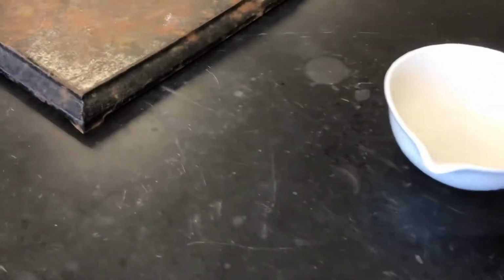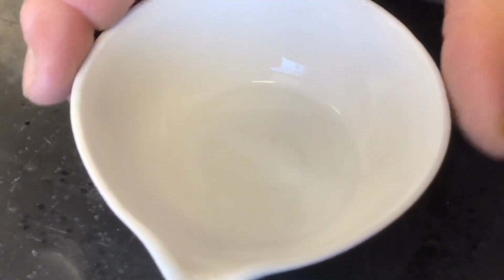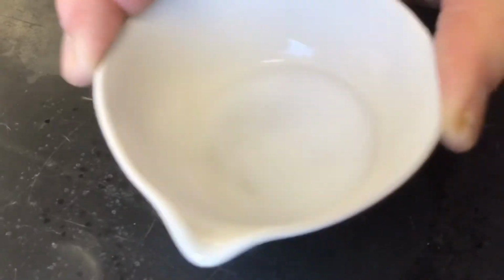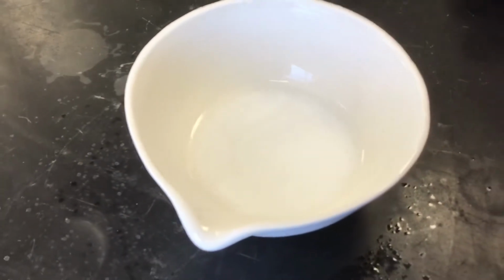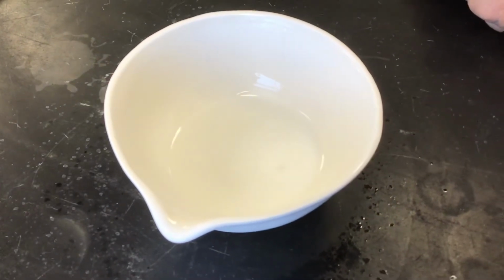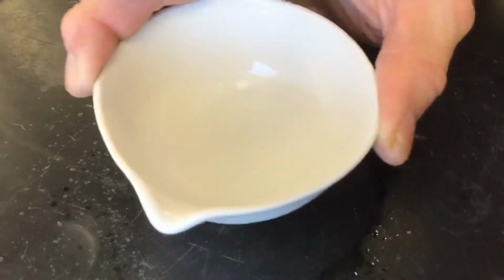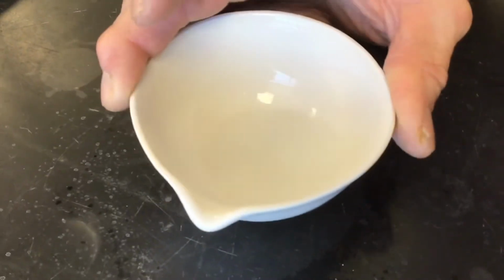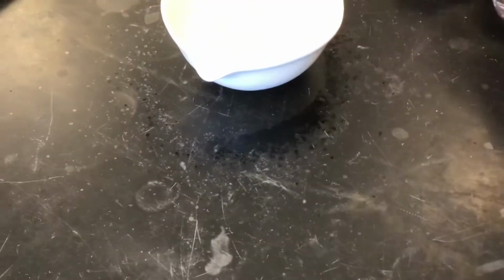Okay, there's still a little bit of bubbling going on in there, I believe. I think we can see it a little bit. Oh, there it goes. Yeah, it does take a little bit of acid to use up all of that baking soda. Okay, I'm going to swirl it again. Okay, I'm pretty confident all the baking soda's reacted.